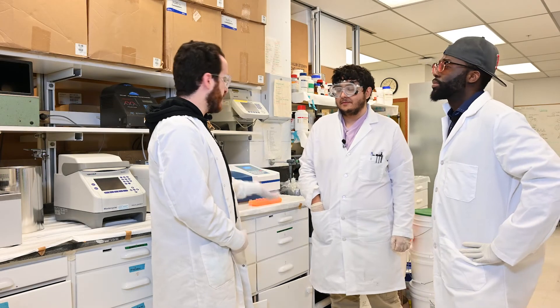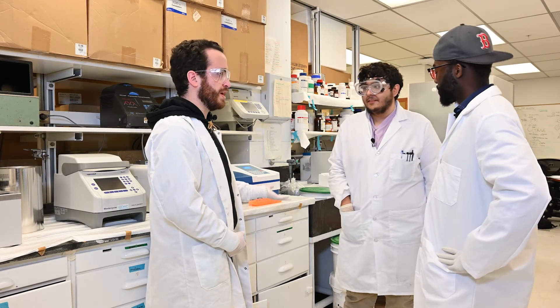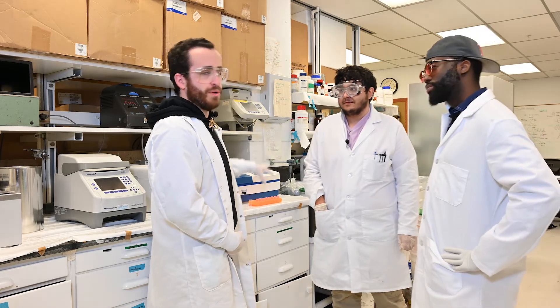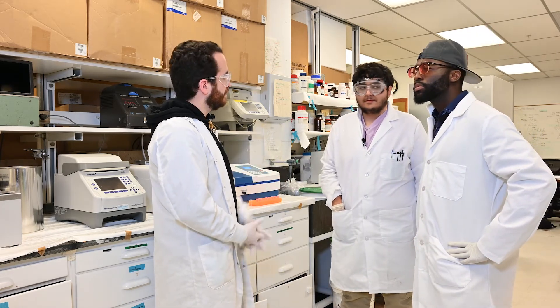So now that we have all our solutions ready, I'm going to put them all in the spectrometer and then take measurements and record the data.